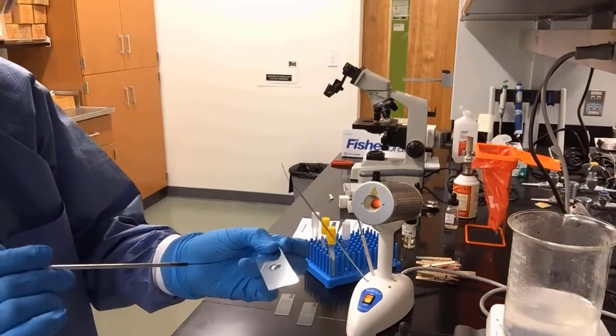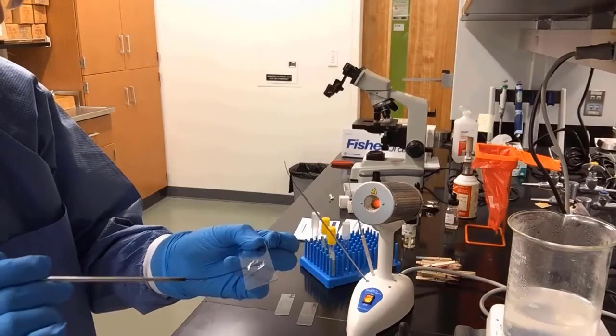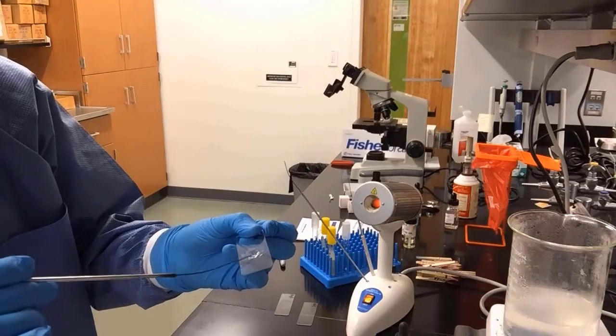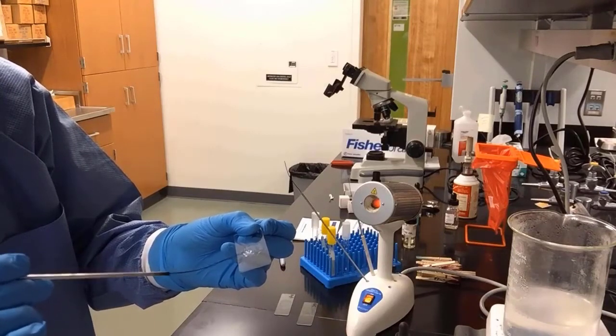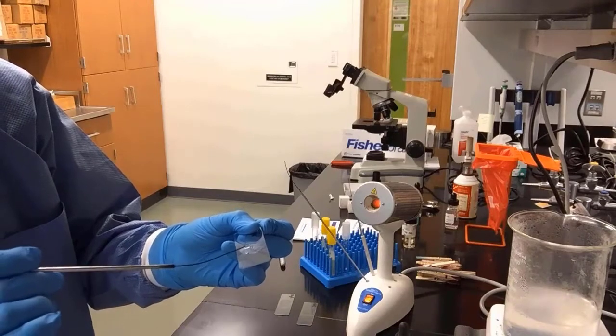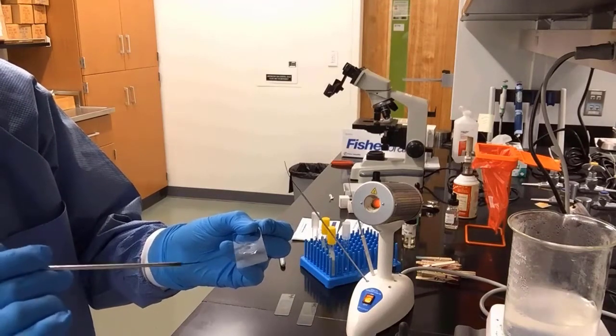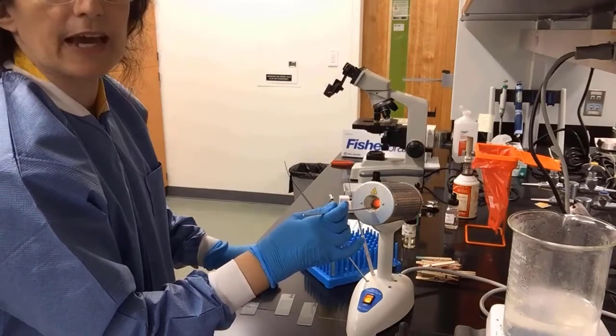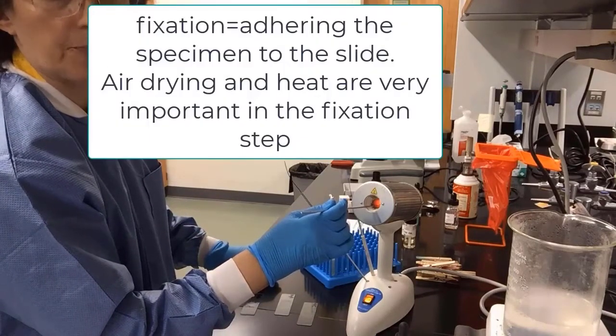We will place our specimen into the drop of water and smear, trying to spread the cells as much as we can into a quarter-sized smear. And this is for our Bacillus cereus. We will now sterilize our loop, and we have created 3 smears.